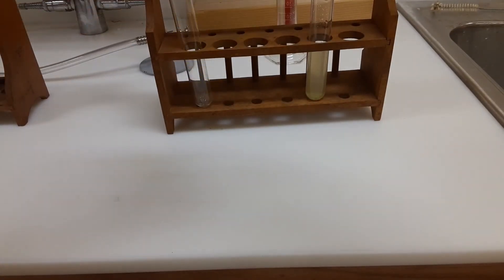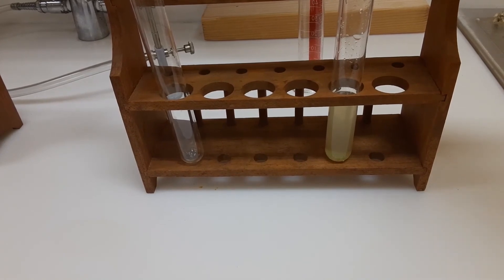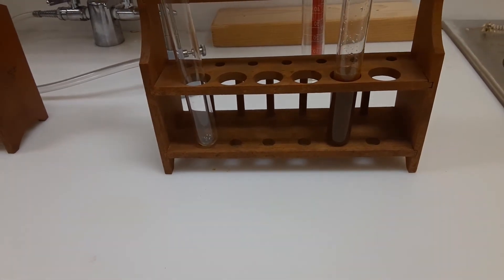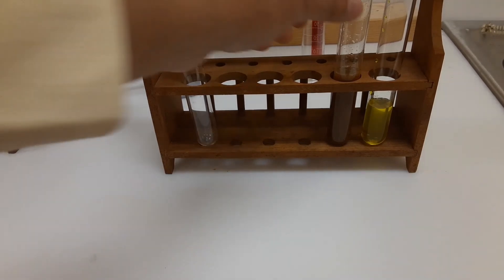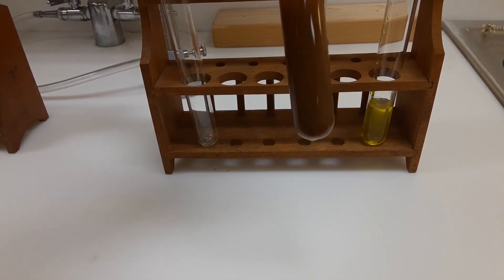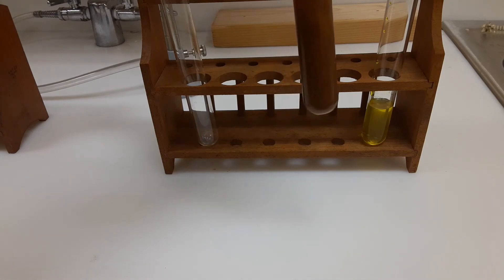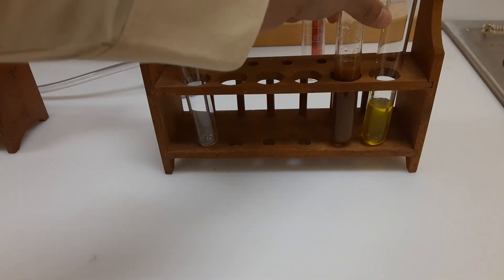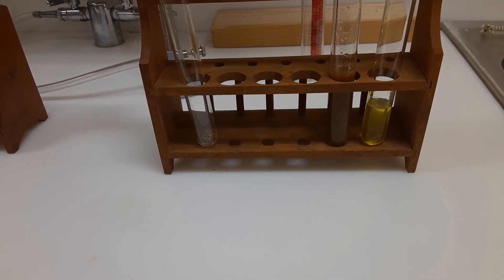We want to find out what happens when we mix these two solutions. I am going to pour the potassium chromate into the iron sulfate solution and see what happens. As soon as the potassium chromate was added to the iron sulfate solution, you can see that the solution has kind of turned muddy, and there are some solid particles. We're going to let this sit for a while and come back to see what happens.